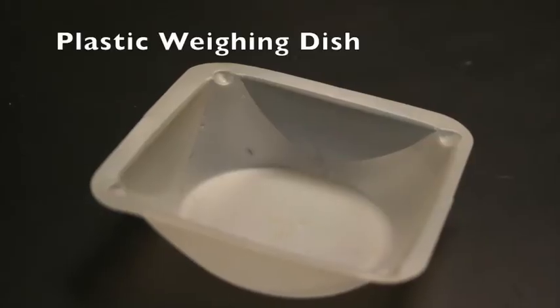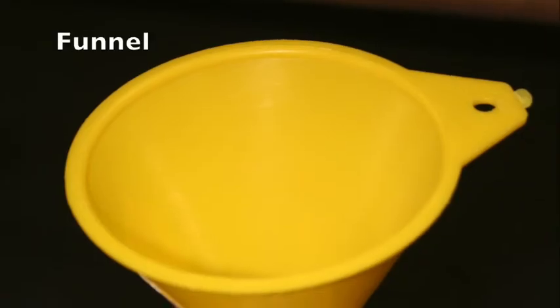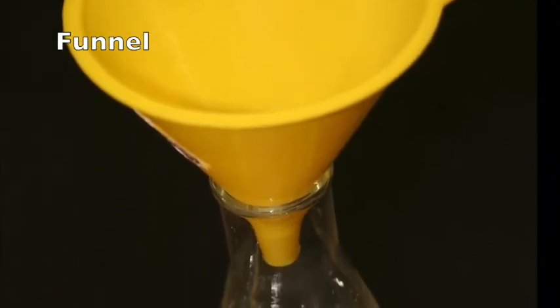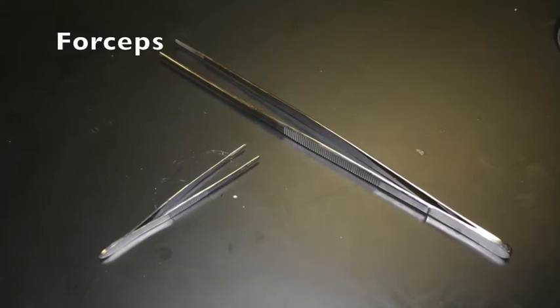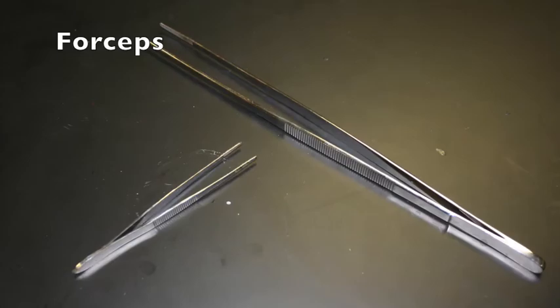A plastic weighing dish is often used to hold small amounts of substances when measuring. A funnel is a glass or plastic cone-shaped tool used to pour liquids into small opening containers such as a flask. Forceps, also known as tweezers, can be used to pick up and hold small objects.